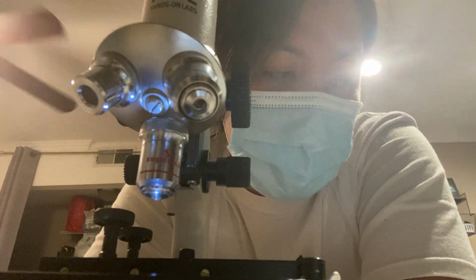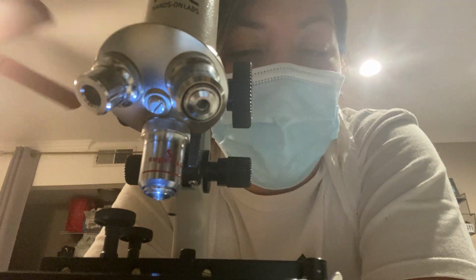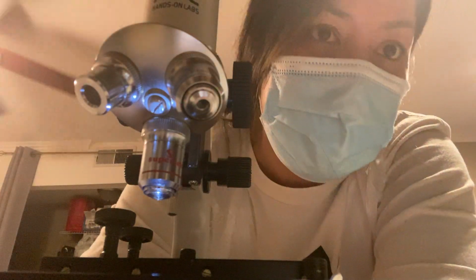And it seems like most of it I was seeing under, you know, medium to high power. So I will upload my photos, and thank you for taking the time to watch this.